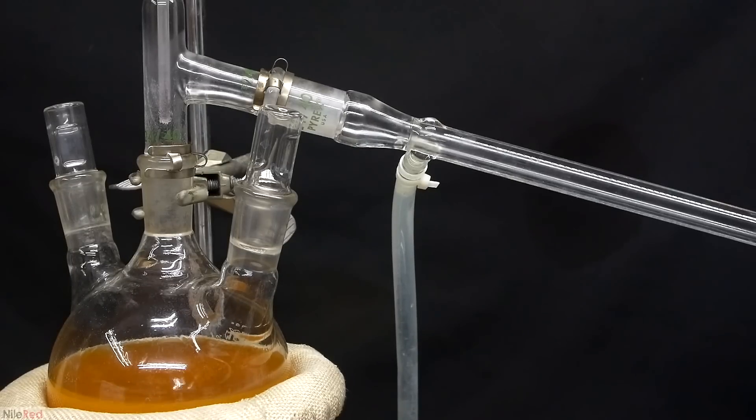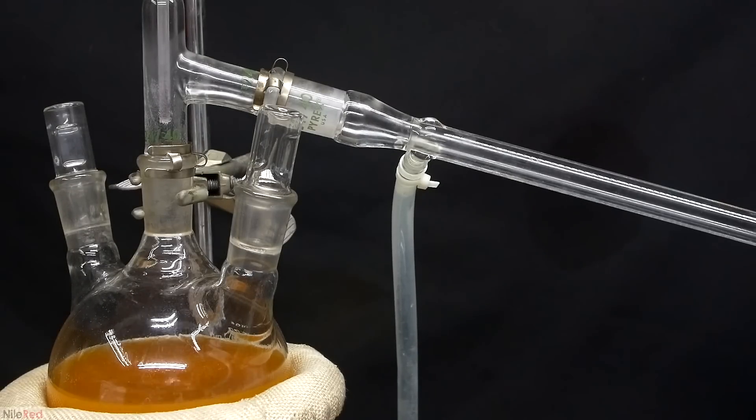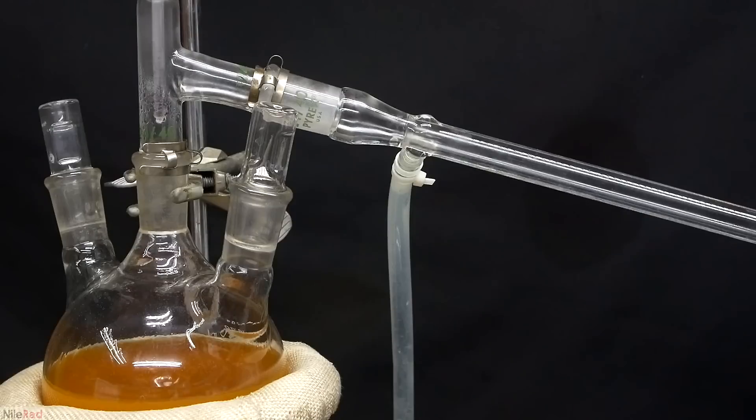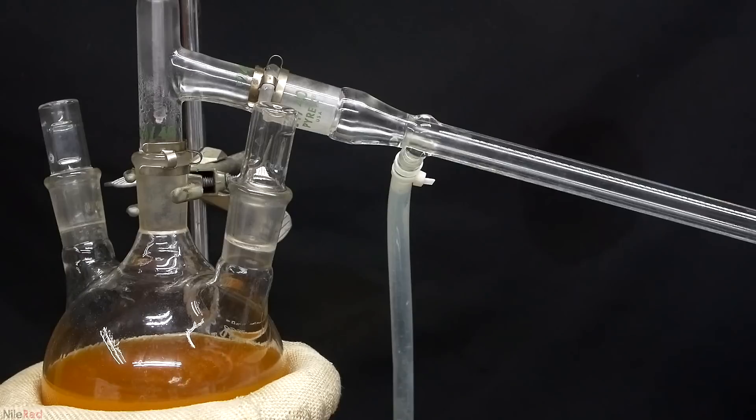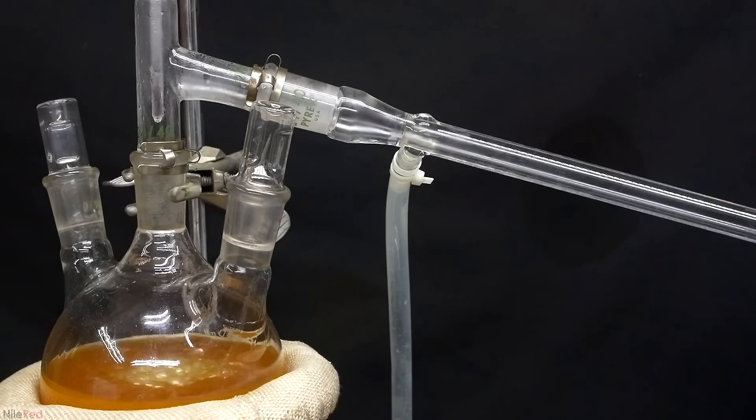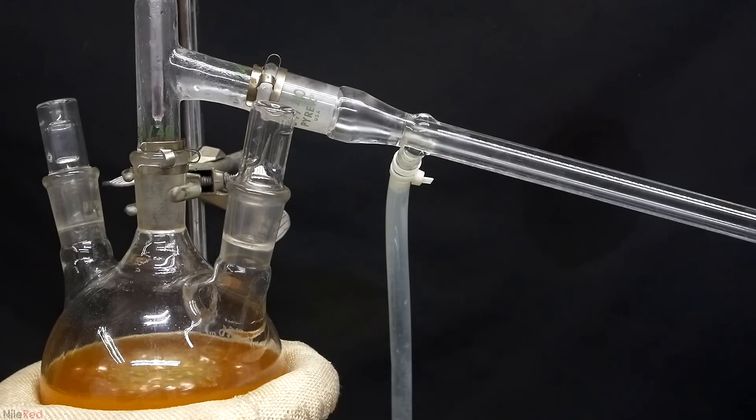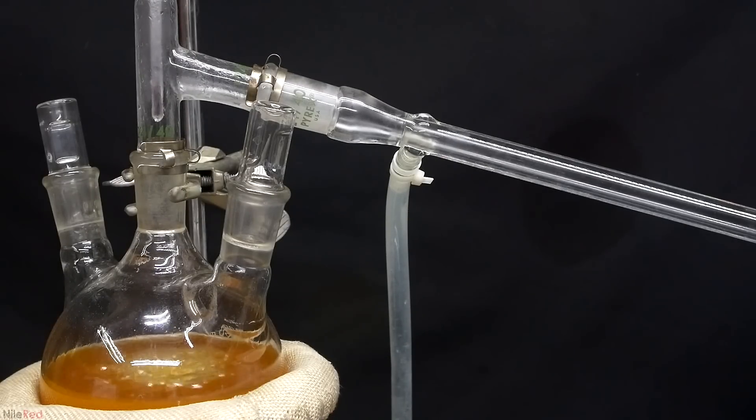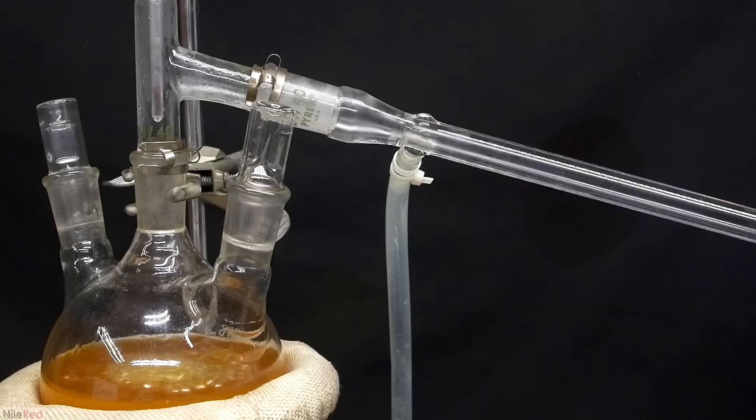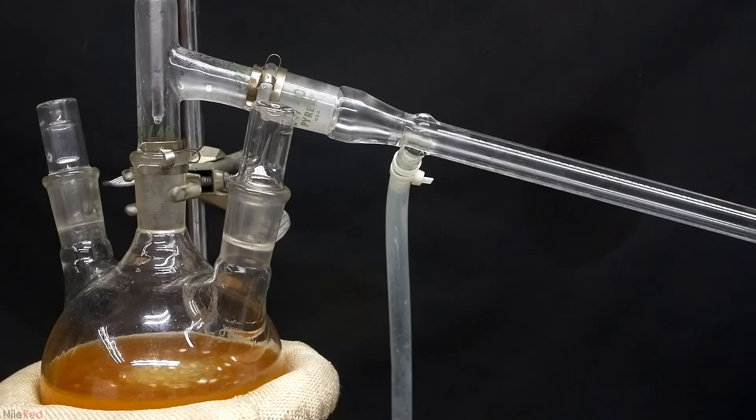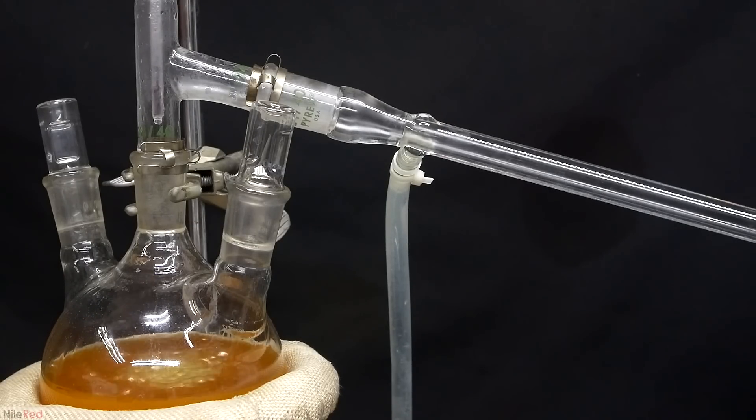I should point out that we're not carrying out a true steam distillation here. In a real and proper steam distillation, the steam is produced in another flask and it's pumped through our reaction flask. I don't think this method gives you better results, it's just a lot more efficient in terms of how much water you have to boil off. I opted to go with the lazy method and you'll see in a bit why that might have screwed me over.